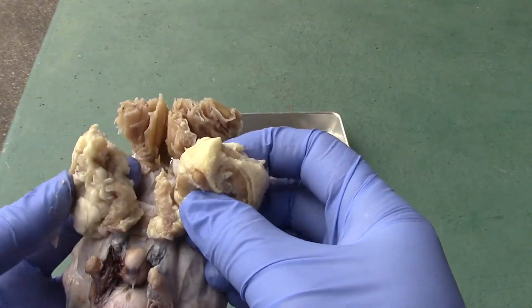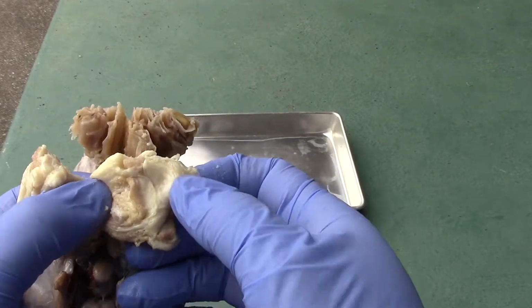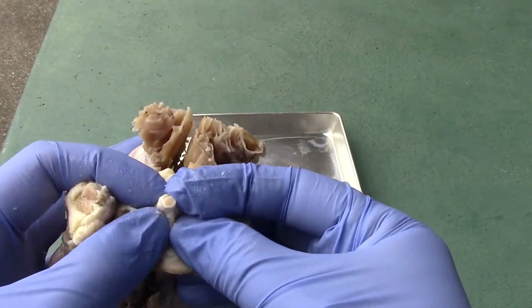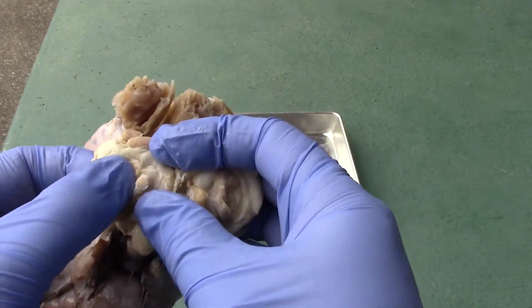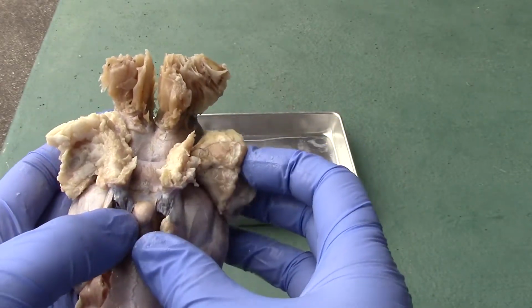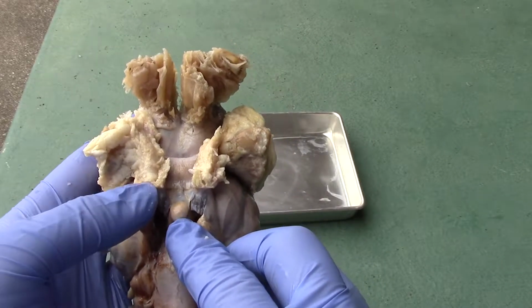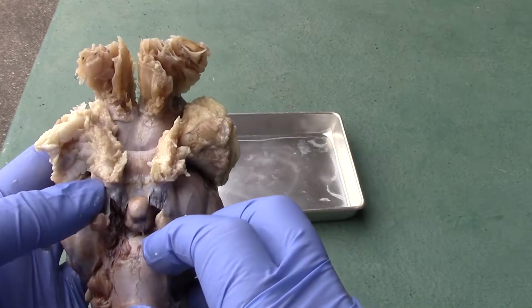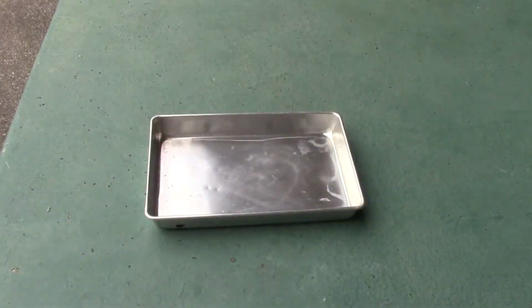These two structures here are going to be going to the eye. So what you see here, the majority of this is the orbital fat that surrounds the eye. You could kind of see the optic nerve going through it, like right there. It's the optic nerve. And so I'll be taking some of this off so that we could expose the internal structures a little bit better. You can also see right in the middle here, this is where the pituitary gland is located, and I'll show you more regarding that later as well. Okay, so let's go ahead and start dissecting this off.